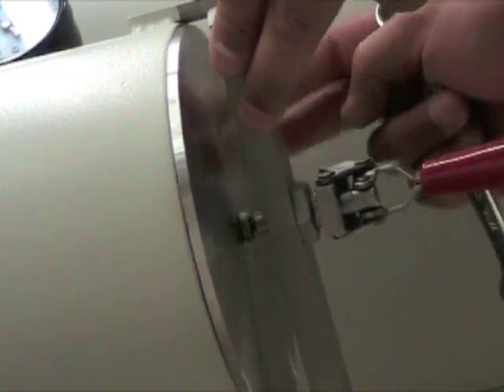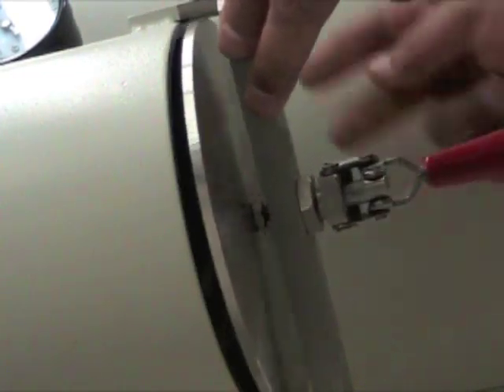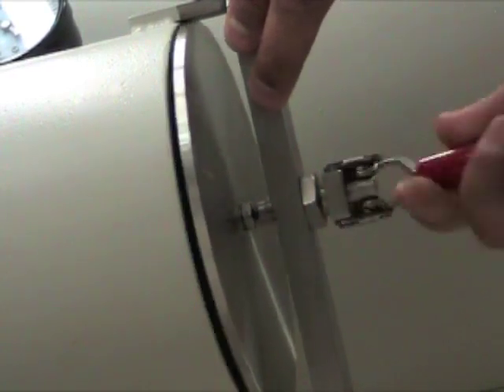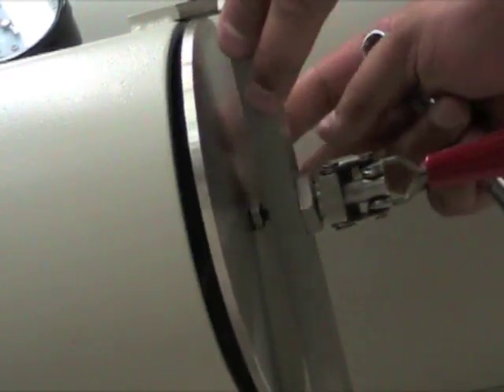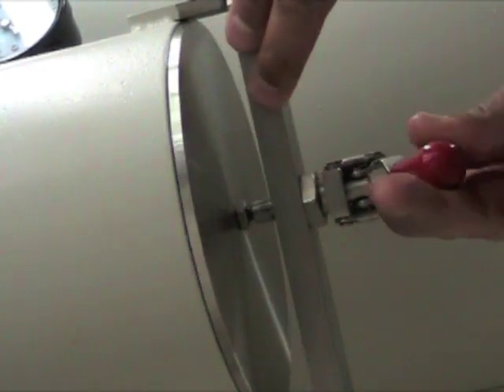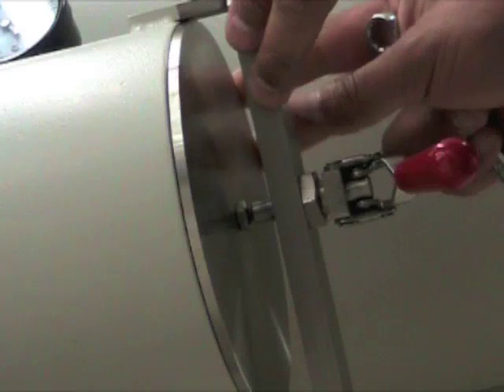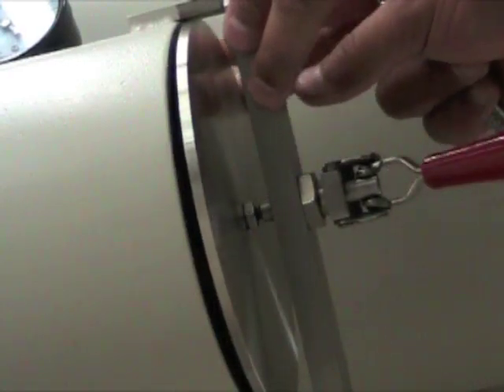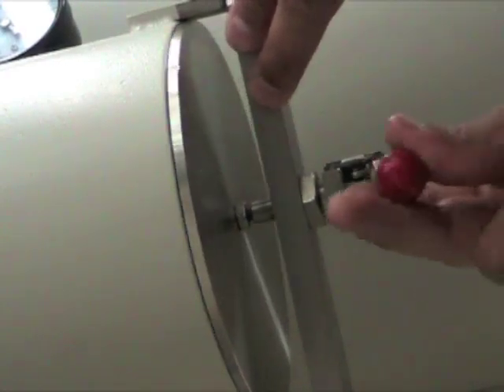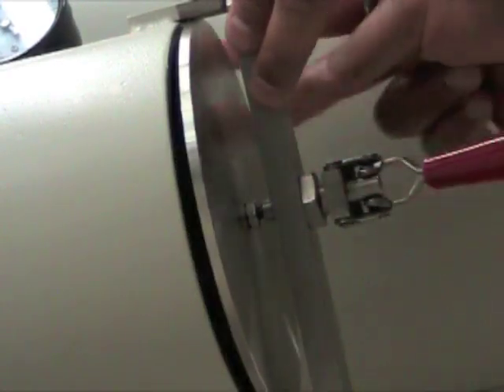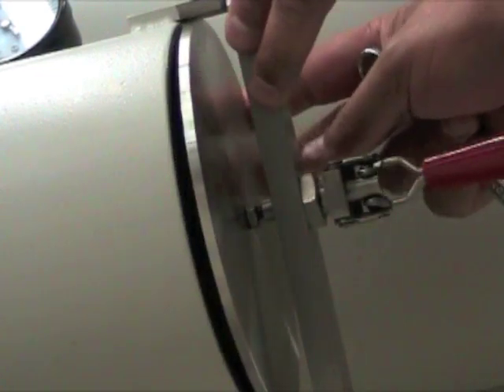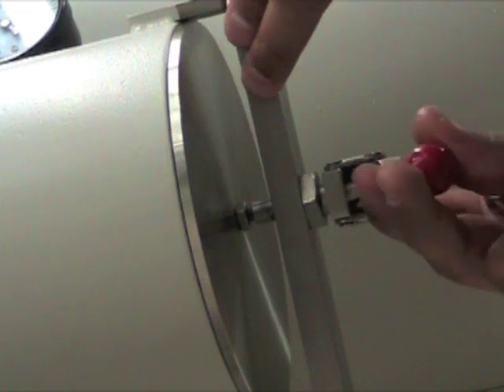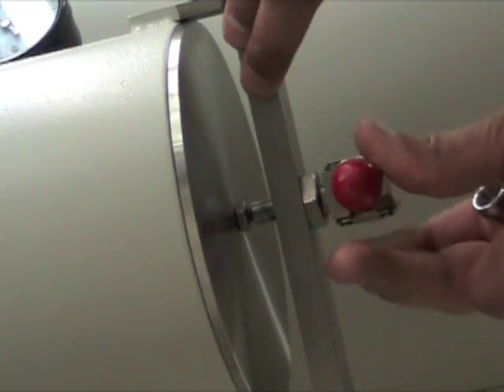So this is too tight. So we're going to loosen that up a little. And I've gone too far now. So it's just a matter of trial and error here. And I think, yeah, this is it right here. This is what we want. Not too loose, not too tight.